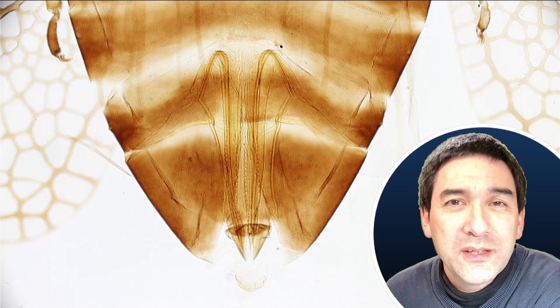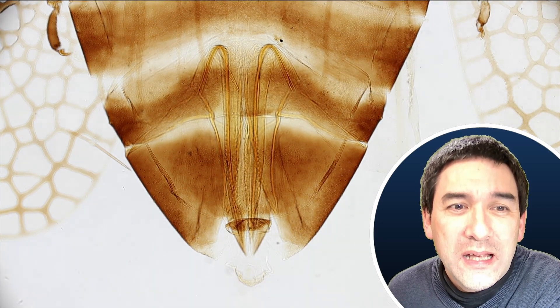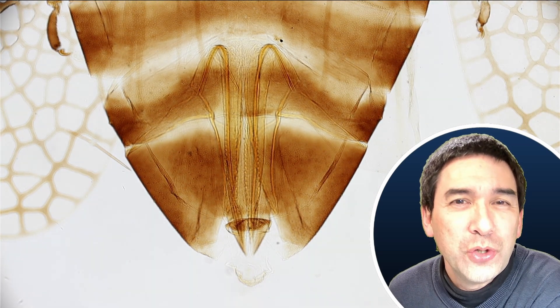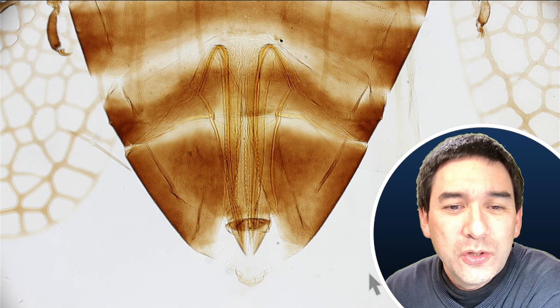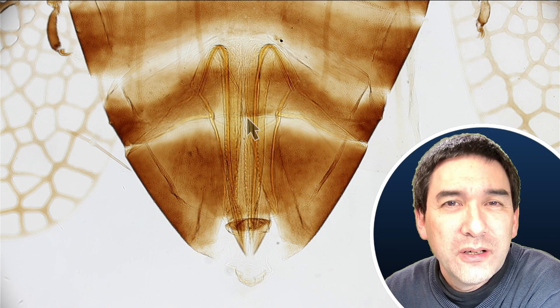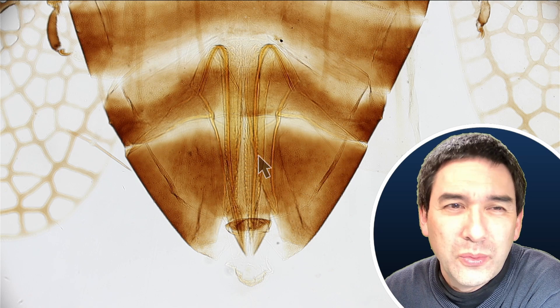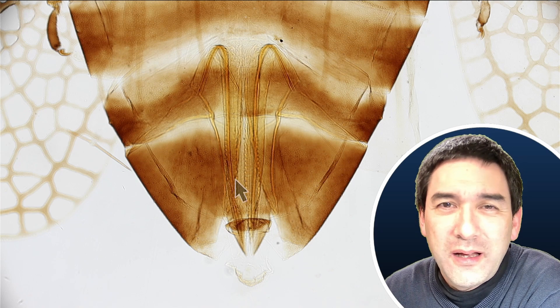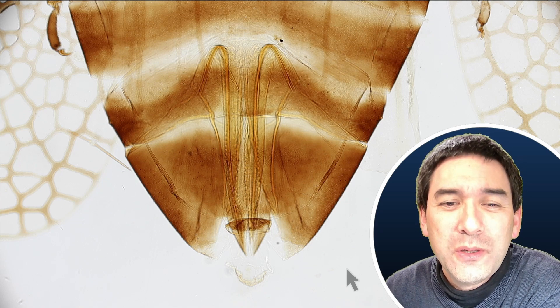Also a little bit strange here: those insects that do have those net-like wings actually should not have a stinger. But look, this almost looks like a stinger here — or two even. I don't know what it is, but this is not really very clear to me.